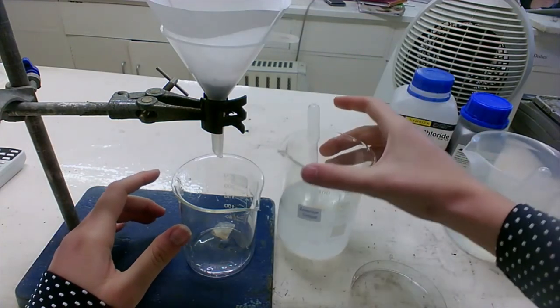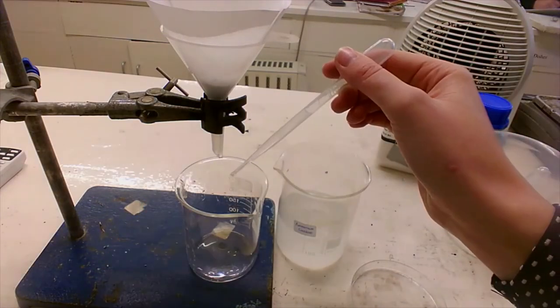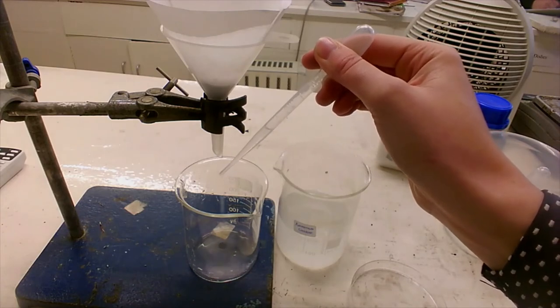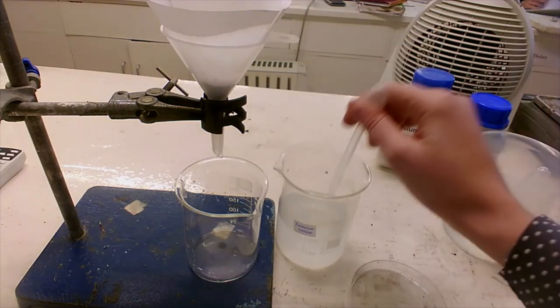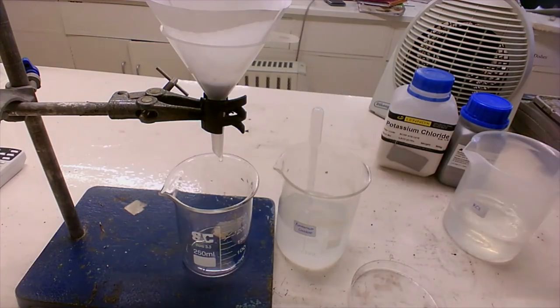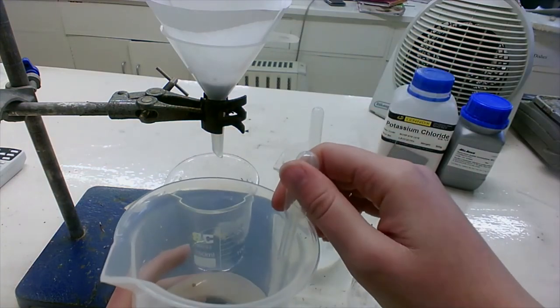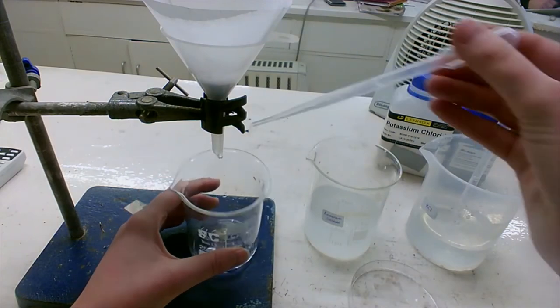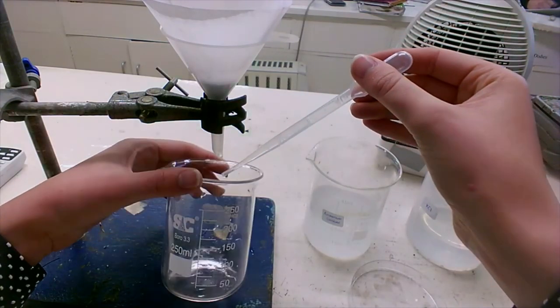So I have my ammonium oxalate again and I just have to test the leachate. I add in some of the ammonium oxalate. It's forming a white one, but it's not as distinct as the last time. It still has the white to tell me that calcium is present. So I'll add even more in. I'll test it again now and see — do we have the white precipitate formed again? No.